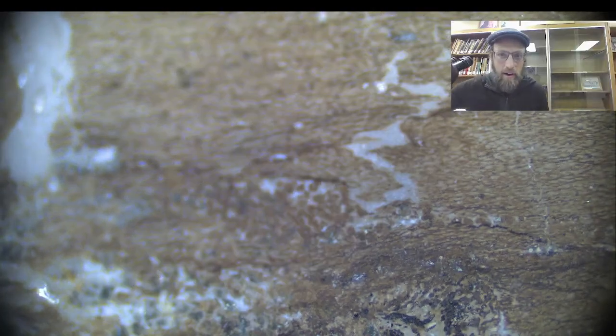And underneath there, those grid lines are like 2 millimeters across. So pretty small. I'm going to try to take a photo there. I wish the light was a little better. But that's one of my jobs right now, to make an atlas of the coprolites.